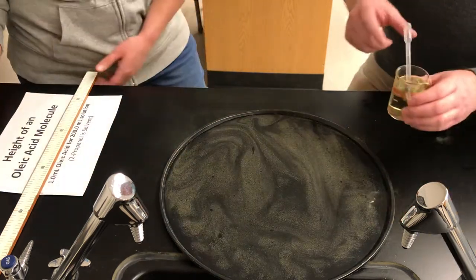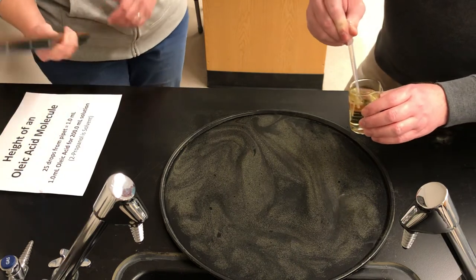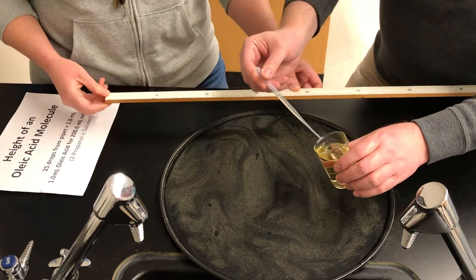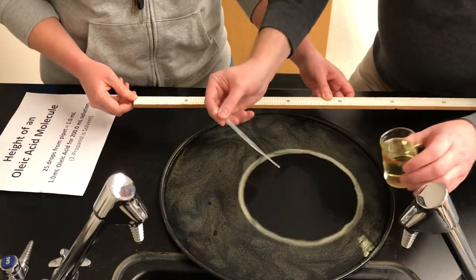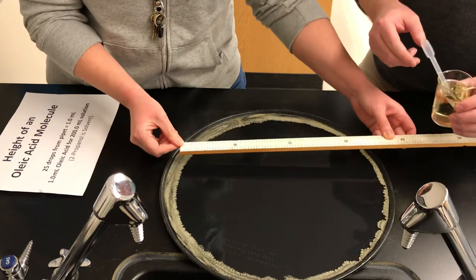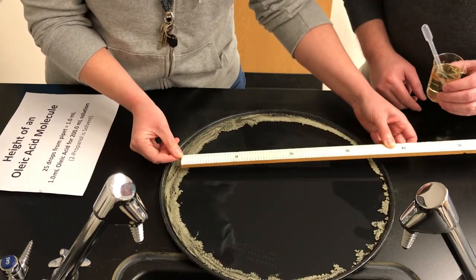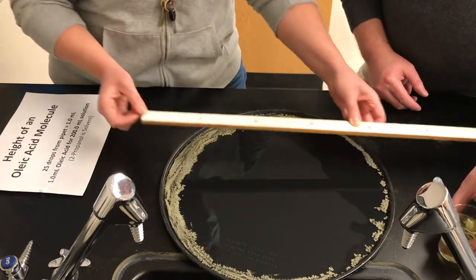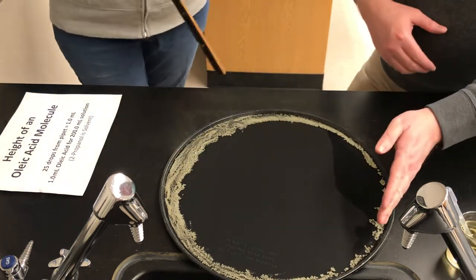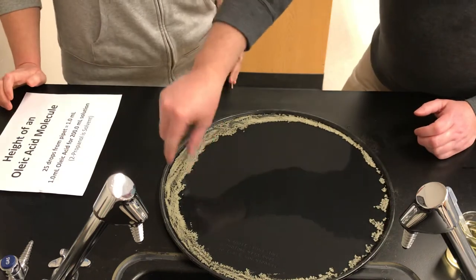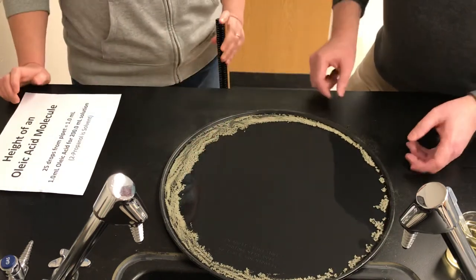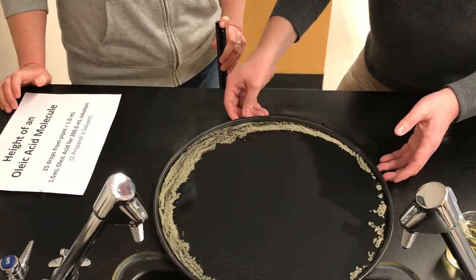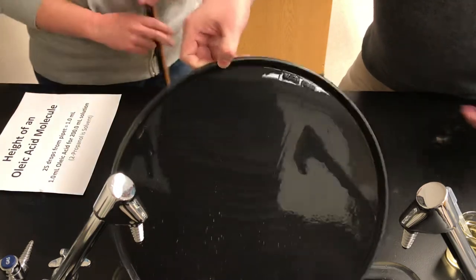That's great. So I'll add one more drop. And Ms. Watts, this time you can make the measurement call yourself. So we'll just have to do it quickly before the circle starts contracting. So here we go. And I screwed that up, didn't I? But I think it'll work. We'll try. Okay. So I think that one's a little bigger. Maybe about 36. Yeah. Now, it reached the edge of the pan here. So that's a little bit of a concern. But we notice over here the powder is, yeah, it's thicker. So the circle is not spreading out to be the full diameter of the pan. Otherwise, we would need a larger pan.